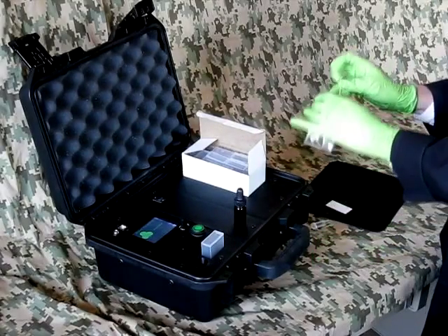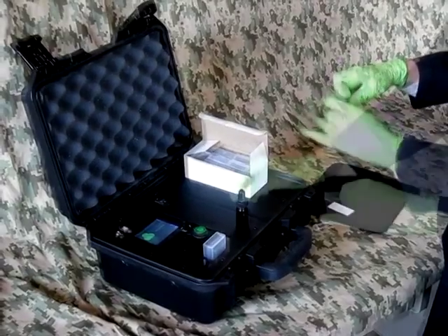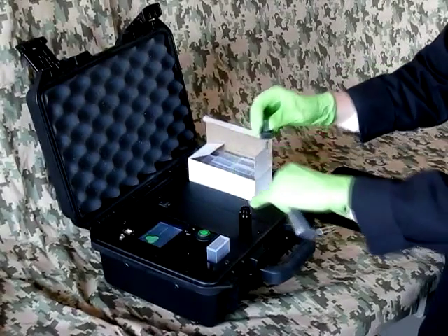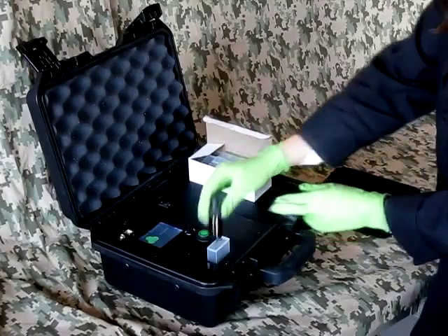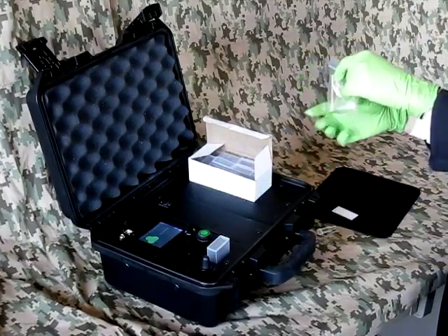Put the swab in the baggie and add a dropper full of acetonitrile to the baggie. Agitate for 30 seconds.